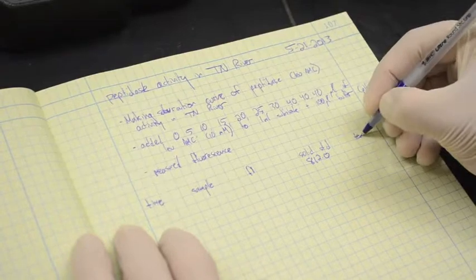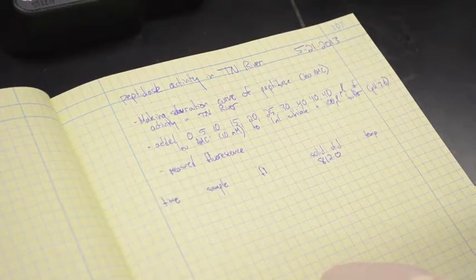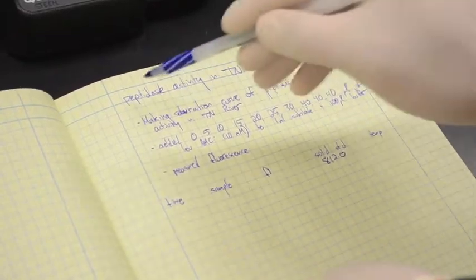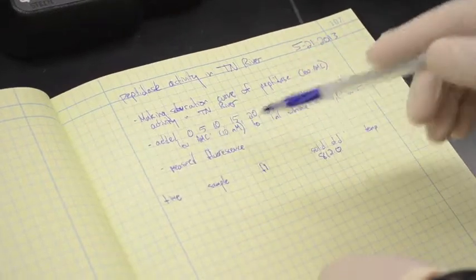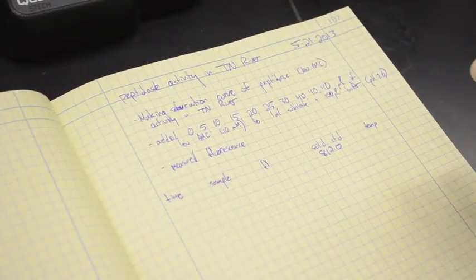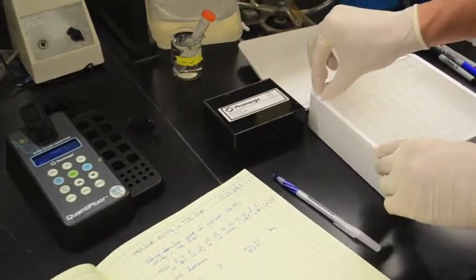Of course, whenever we do any kind of scientific experiment, we always make sure to record everything we're doing in a lab notebook. Every page of the lab notebook should have a date on it right there. It should have a title describing what that page is about. And then in this case, I've described sort of the general purpose of what I'm doing and the procedure of how I did it. And then I've got this table set up to record the actual data. So the way we want to record data is we take out the cuvettes one at a time.